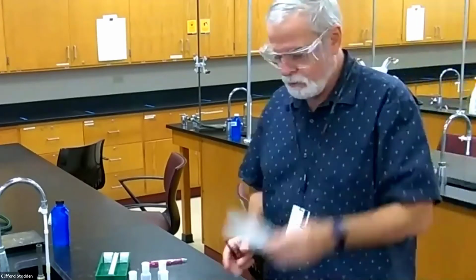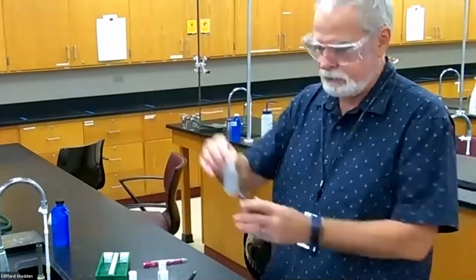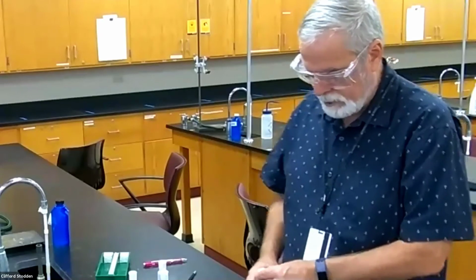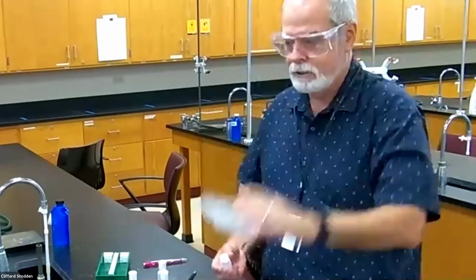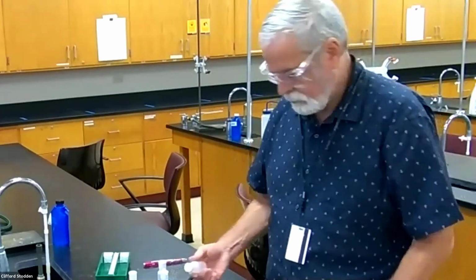Okay, a brand new well plate, aluminum nitrate. You could add the nickel, the silver, HCl, sulfuric acid, ammonia, and sodium hydroxide. I might as well add all those because there are 6 spots across the well plate, so I'll just put aluminum nitrate in all those. Okay.